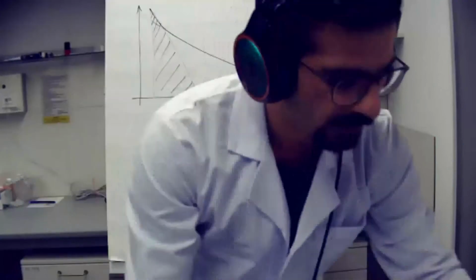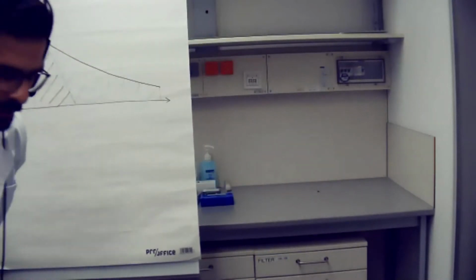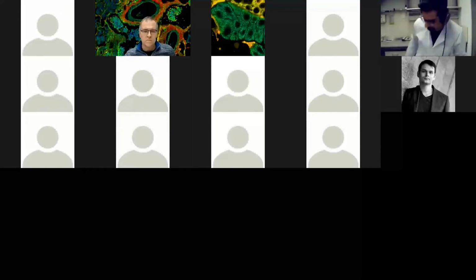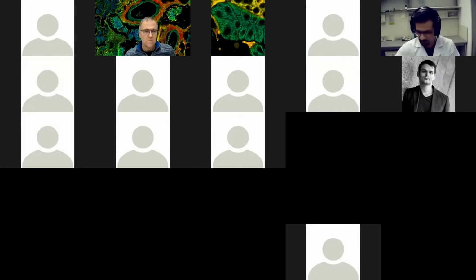That's where your lifetime is, and over time the amplitude is dropping down as 1 over E. I hope that was clarifying something regarding the amplitude and the intensity. So the intensity is the area below the curve, and the amplitude is the value that we have when we are going to define the lifetime. That's the amplitude, the maximum in the decay curve.